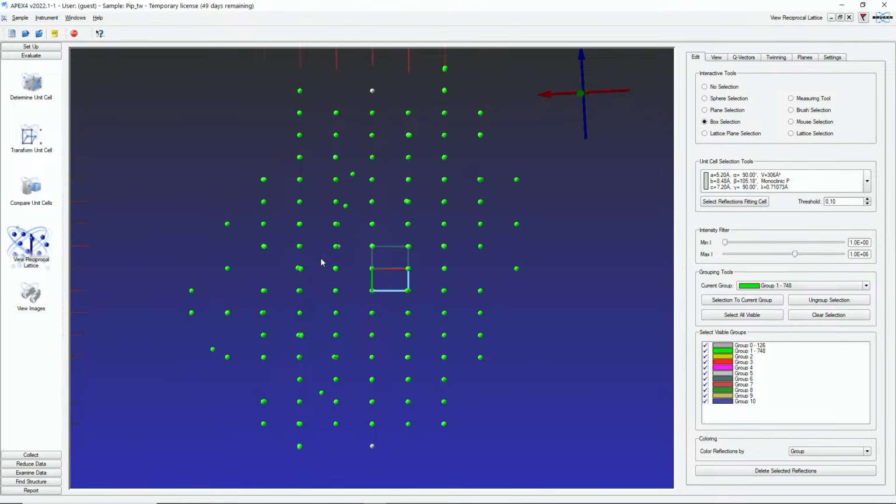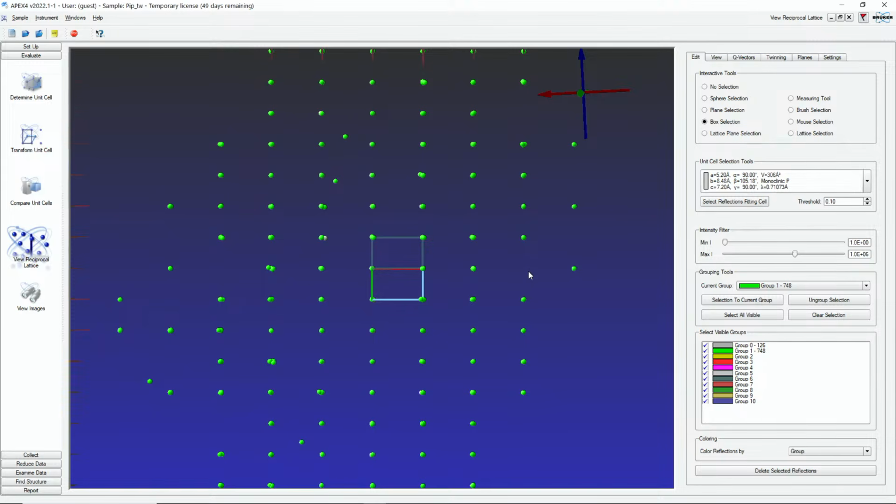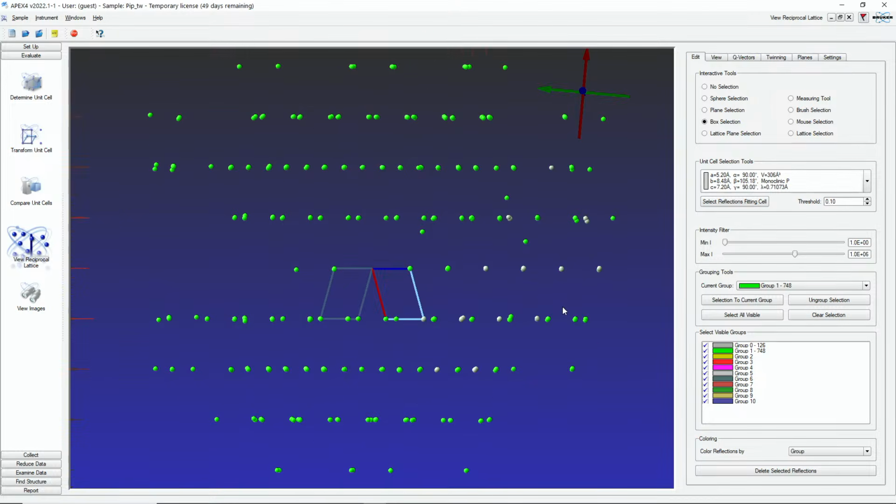So when we look at this, we have these two unit cells now. I can zoom in a little. And again, if we look along A star, B star, now we see the relation to each other. You see how these two are related. We can display these by domains.